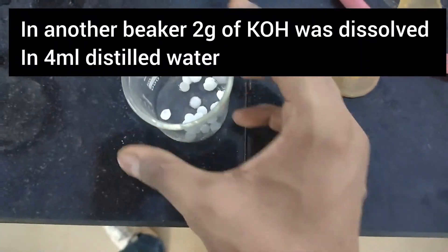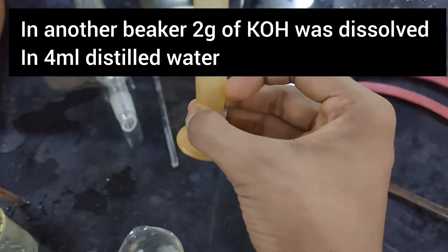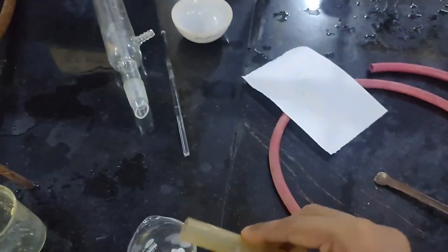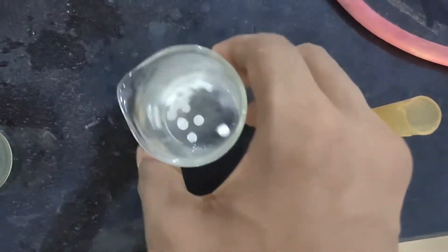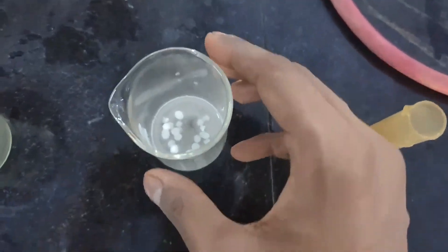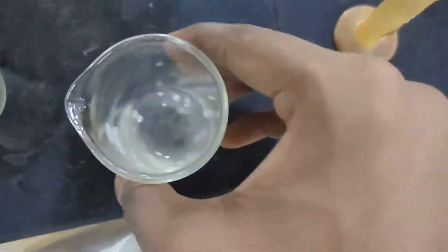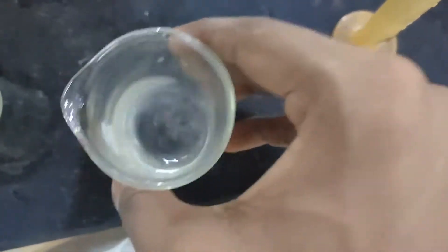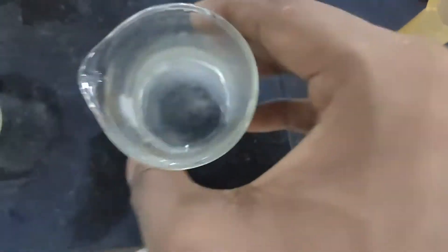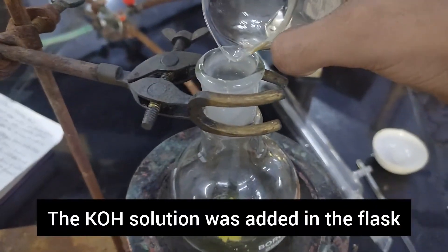Now in another beaker, I have taken 2 grams of potassium hydroxide and am dissolving it in 4 ml of distilled water. The beaker was swirled and soon the potassium hydroxide dissolved to form a clear solution. This solution is then added inside the flask.